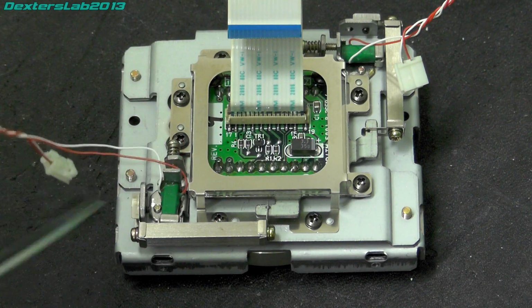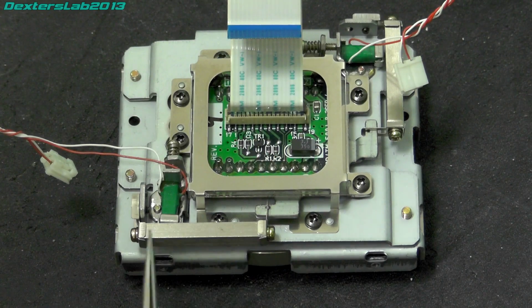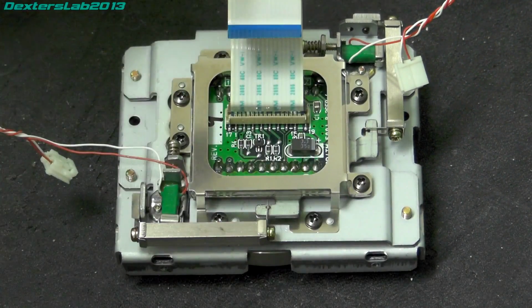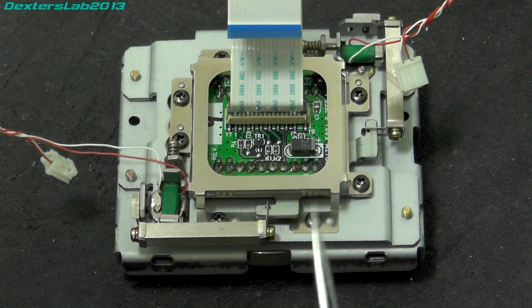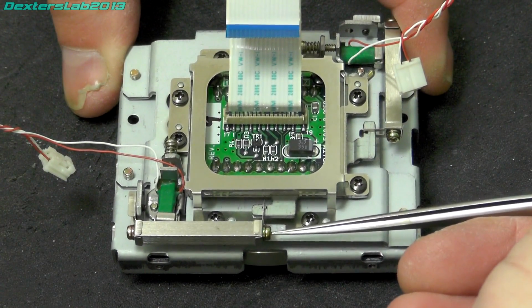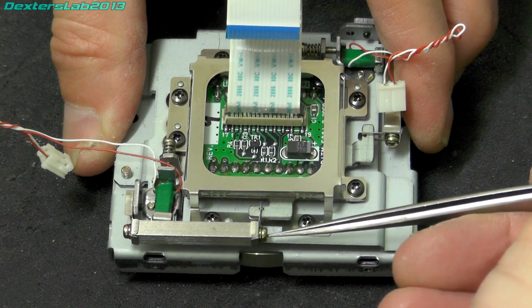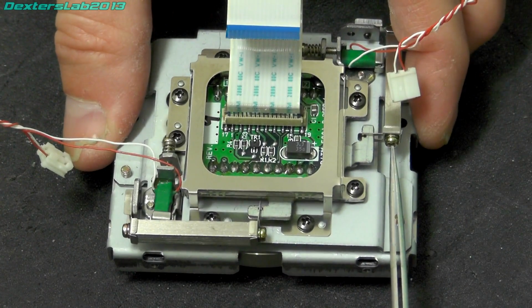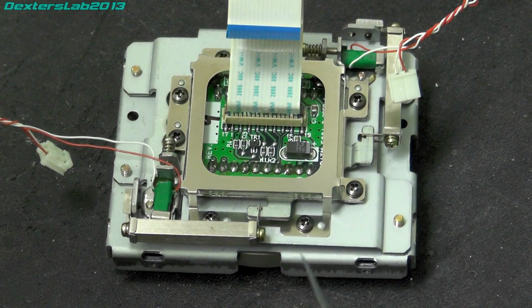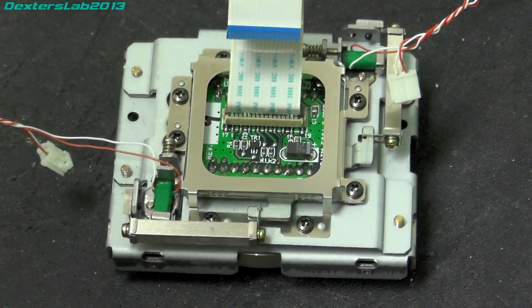There's lots of little set screws and calibration screws and stuff. So what this is doing, this pushes down on here onto this long bar. So presumably if that extends, it will push this bar downwards towards the bottom of the picture as you see it, which will then pull the CCD downwards. So if I just do this, you should be able to just see, hopefully, it moving that way. And again, if I move it this way, it's a little bit harder to see it in that direction, but you get the idea. So that'll allow you to move it into any of those nine positions. So the center position would be one, and then you've got eight positions all around it.